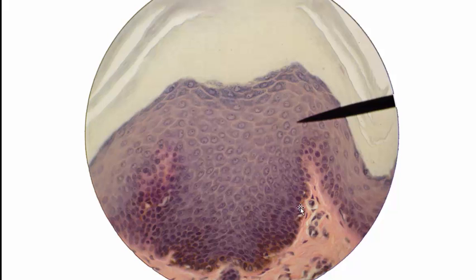By the way, the reason it's called stratum germinativum is that there are stem cells down here that are undergoing mitosis in order to give rise to all of these keratinocytes. Over time, what happens is cells are added down here in the stratum basal by mitosis, and those cells contribute to the stratum spinosum. Sometimes those cells in the stratum spinosum are still dividing, by the way. But as more cells are added, the cells approach the surface. They go through the stratum granulosum layer. They die in that layer.